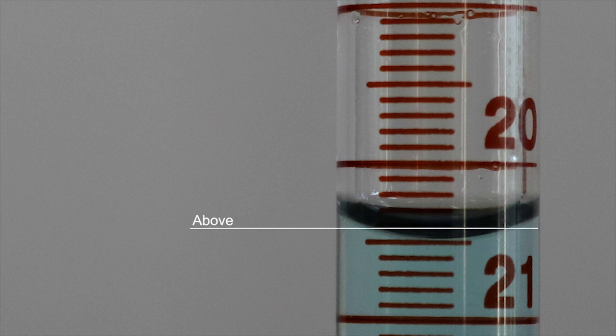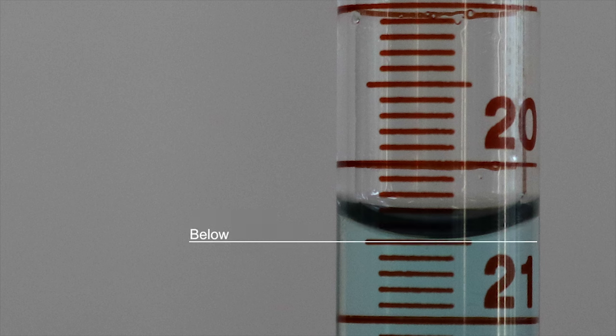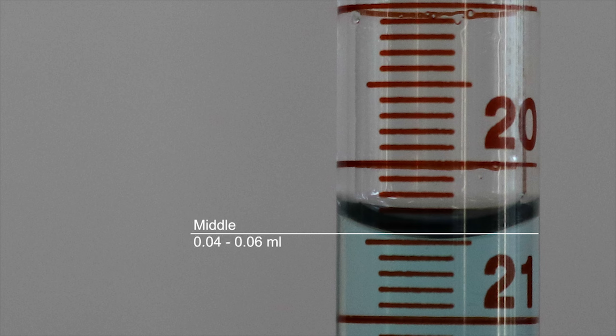If it is closer to the top line, the second decimal will range from 0.01 to 0.03 milliliters. If it is closer to the line at the bottom, it will range from 0.07 to 0.09 milliliters. If it is in the middle, it will be between 0.04 and 0.06 milliliters. However, if the bottom of the meniscus lies on a line, the second decimal place will be recorded as a zero.